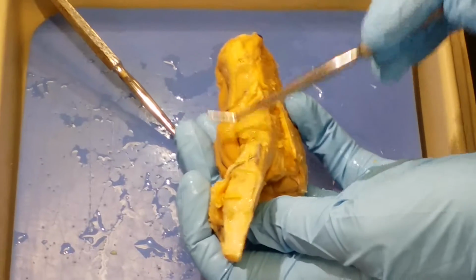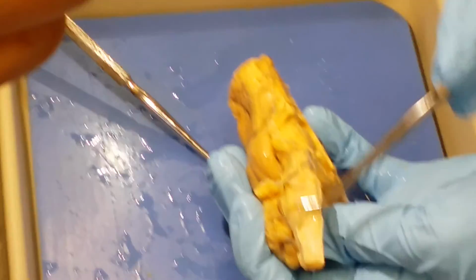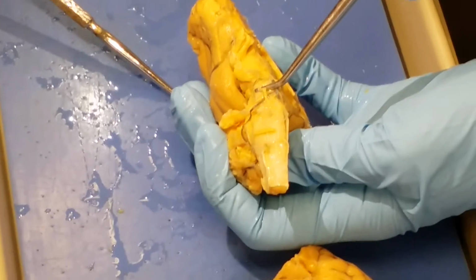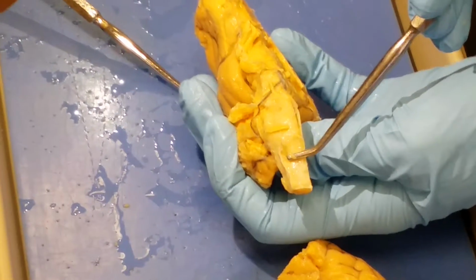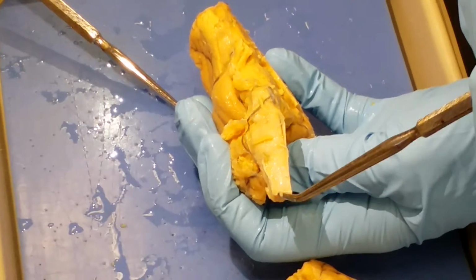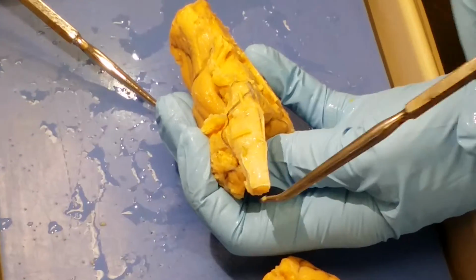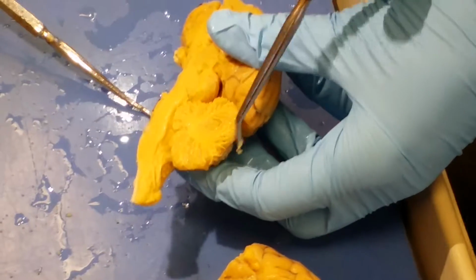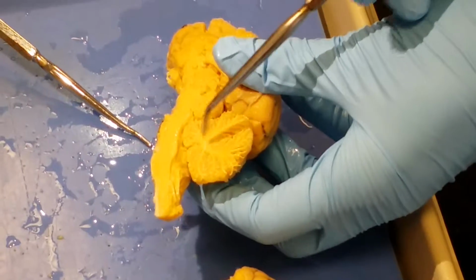Brain stem, take a look here on the bottom. This entire region is the brain stem. The middle part is your pons. Up here is the midbrain, and then down below is the medulla oblongata, which merges to the very bottom, sorry, your spinal cord. Right here is your cerebellum. In your cerebellum, you find your arbor vitae, which are the white lines.